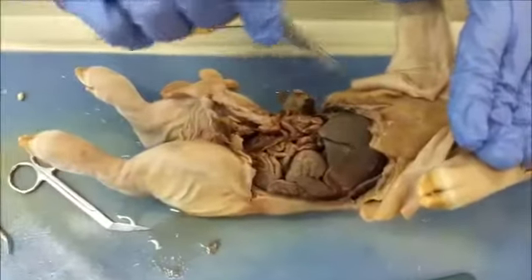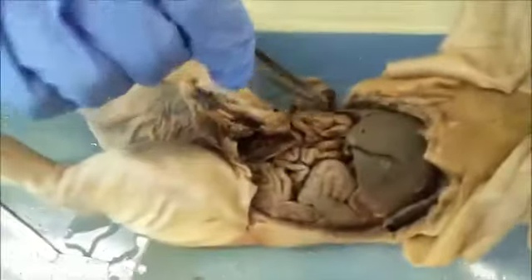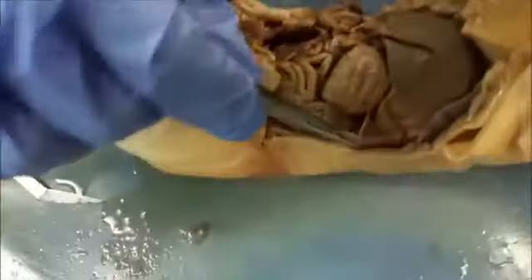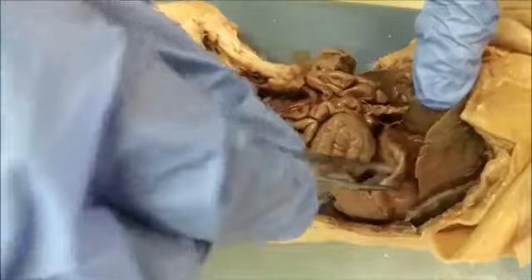Here you can see we've cut open the abdominal wall. Here is the liver, the lobes of the liver: 1, 2, and you can say 3. And then here's the small intestines, and hiding behind that is a section of large intestines. Over here you can see the spleen, this little flap right here with this connective tissue. And then right here, this flappy thing is the actual stomach. And here are some ribs already.